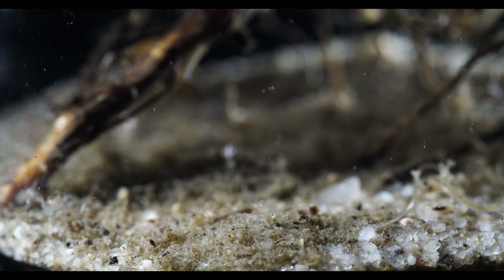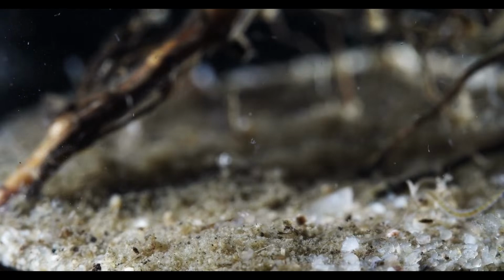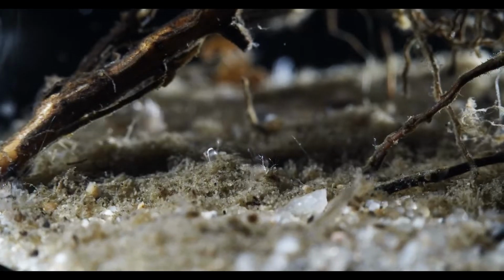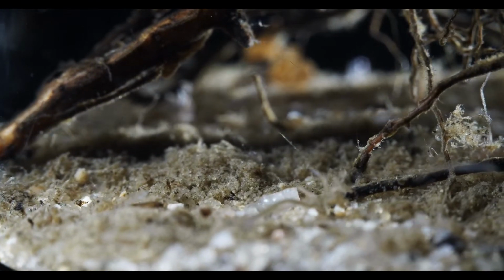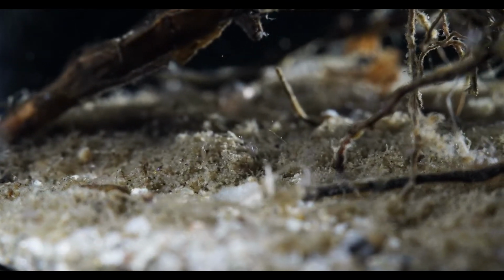Yeah, I hope so. I want to try and look at tardigrades with this setup for sure. But yeah, I mean, I might just wait until I get a pond tardigrade. Yeah, but I'm trading off again.